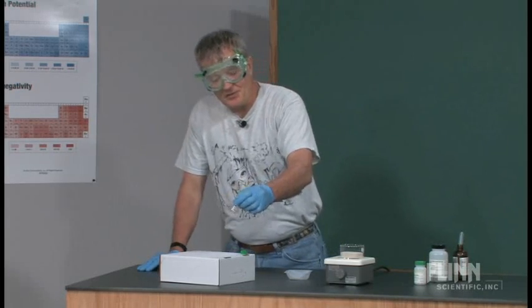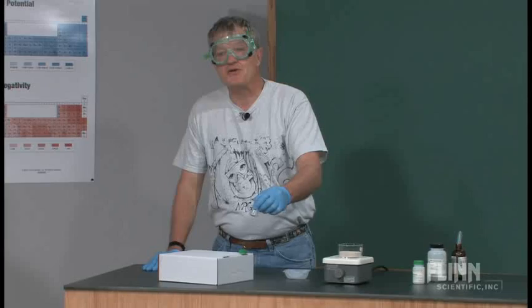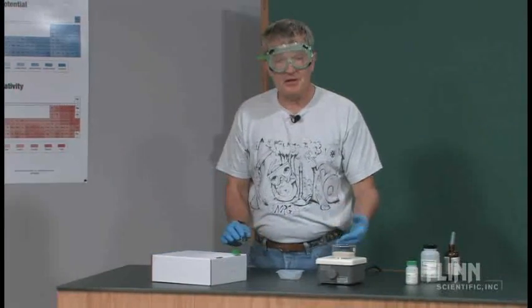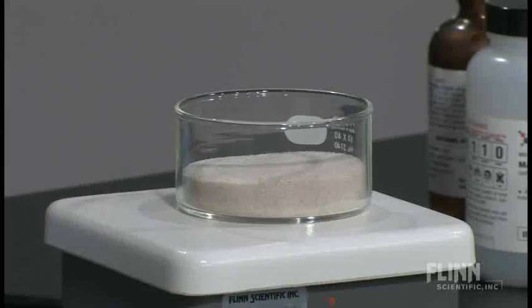The way that we always did that in my chemistry classes in college was to go to a sand bath. Now you can buy commercial sand baths, but they're relatively expensive, or you can make your own sand bath.